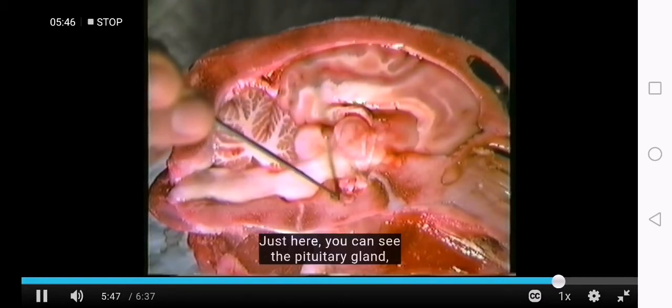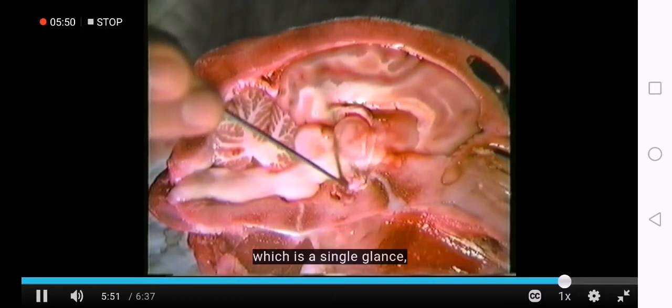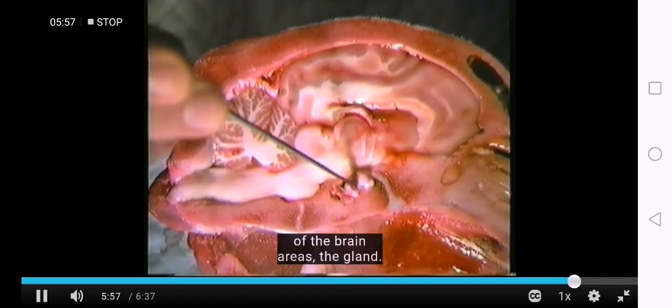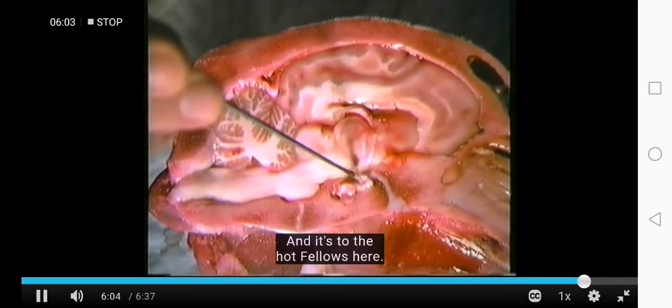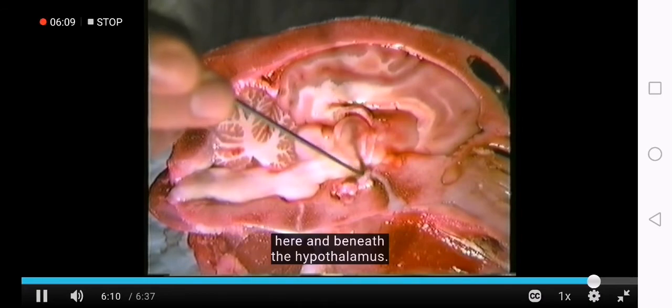Just here you can see the pituitary gland, which is a single gland which lies right in the midline of the brain. There is the gland. It's also enclosed within bone, and it's connected to the hypothalamus here. So there's the thalamus here, and beneath it the hypothalamus.